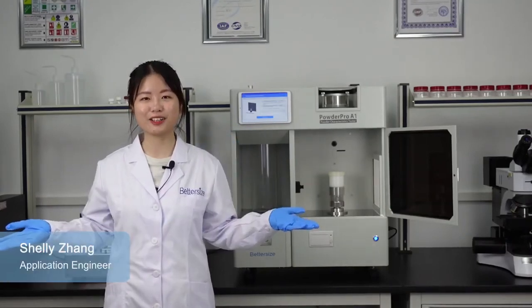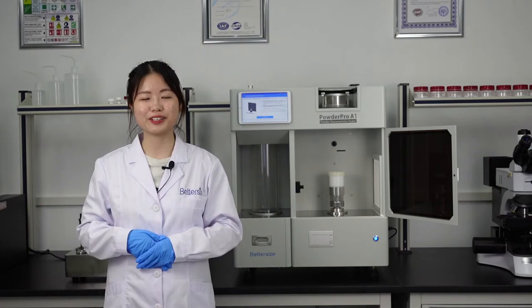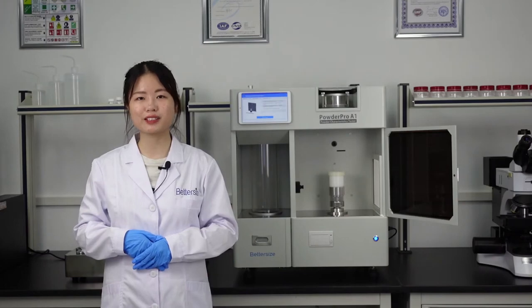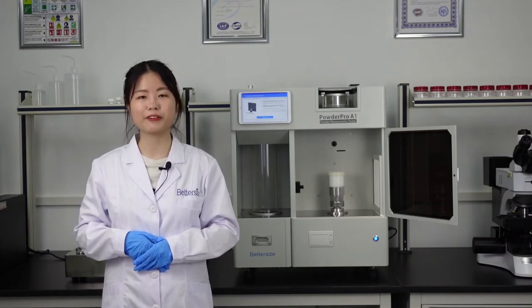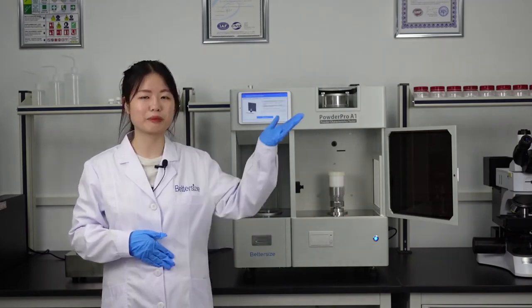Hi everyone, I'm Xiaoyi. Welcome back to the BetterSize channel. In the last video, we measured the bulk density of a non-metallic powder. This time, we are going to investigate the tap density with a fixed volumetric method using the PowderPro A1.